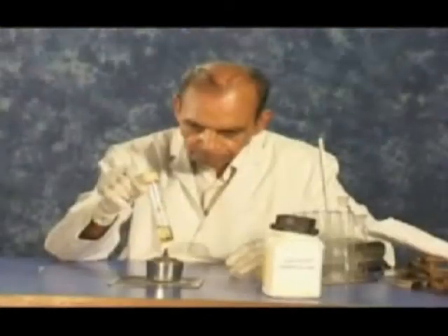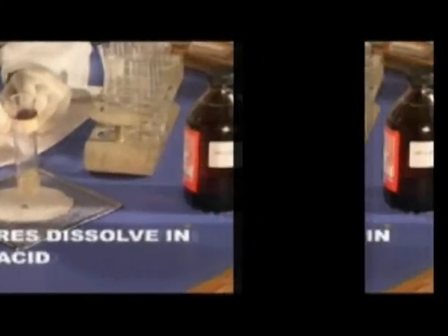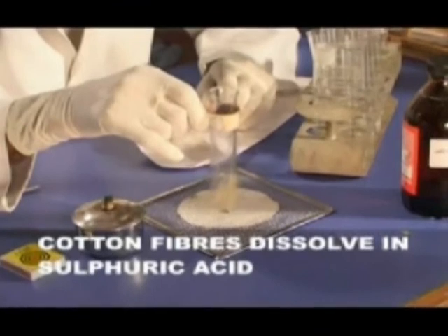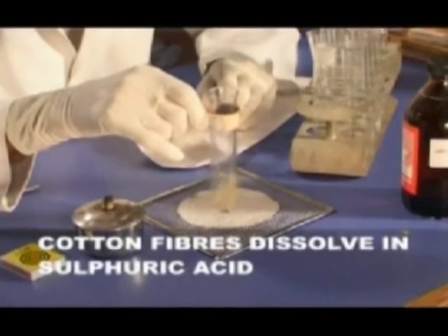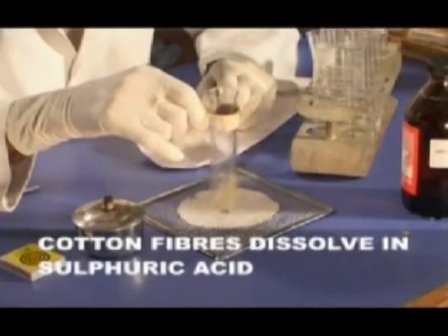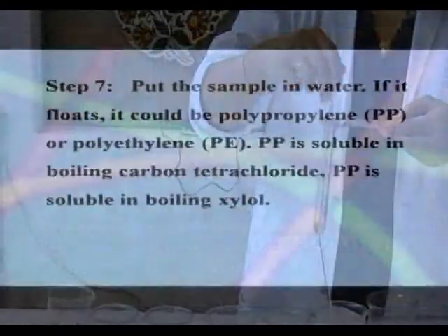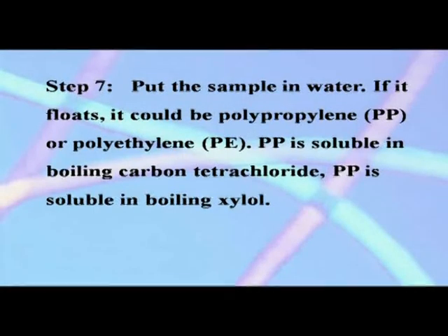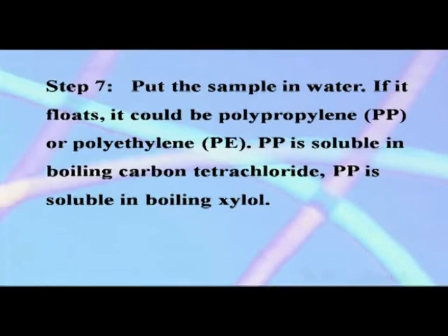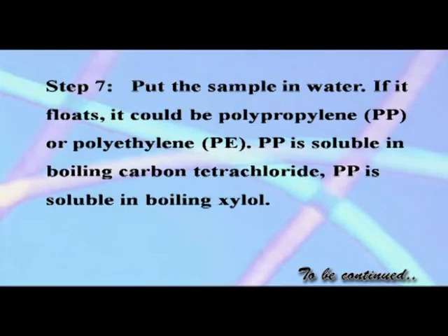Step 6: Treat the fiber with 70% sulfuric acid. If soluble, it could be cotton or viscose rayon. If insoluble in Step 6, go to Step 7. Step 7: Put the sample in water. If it floats, it could be polypropylene or polyethylene.